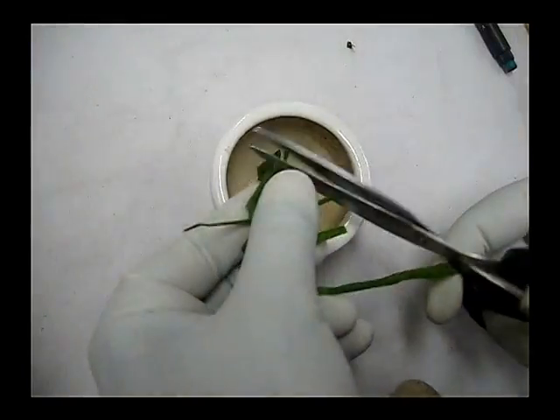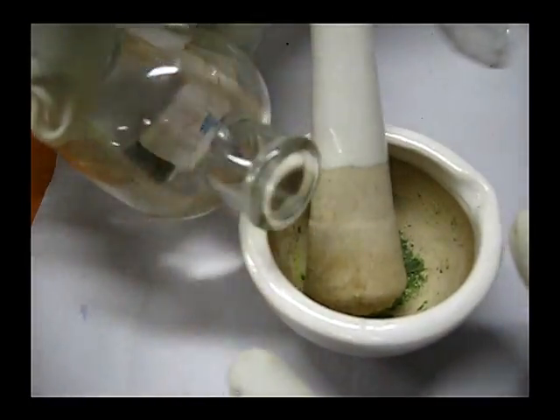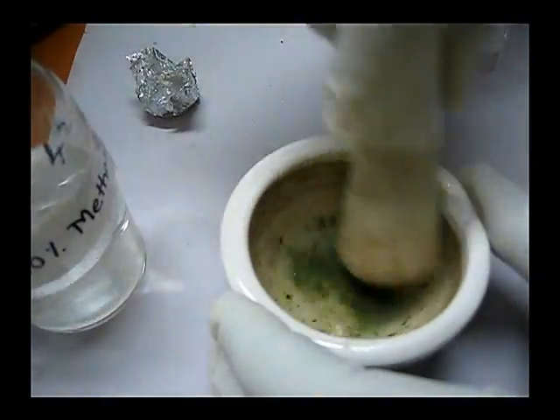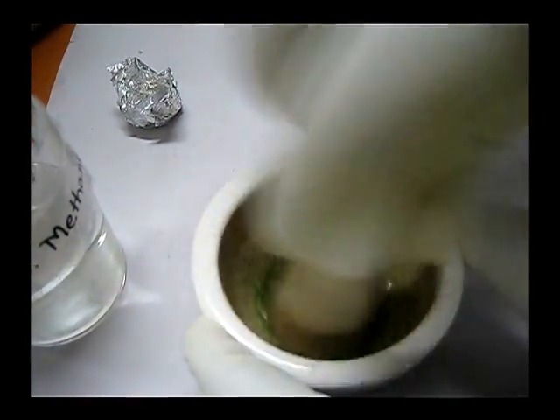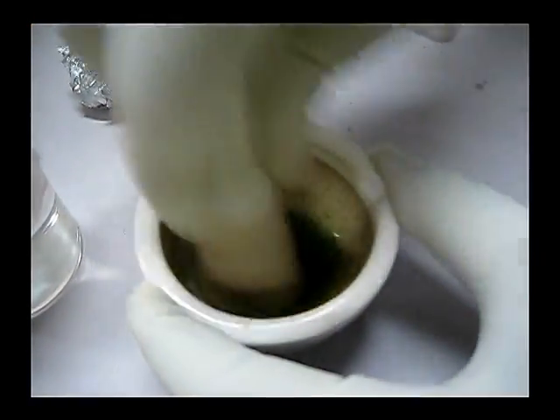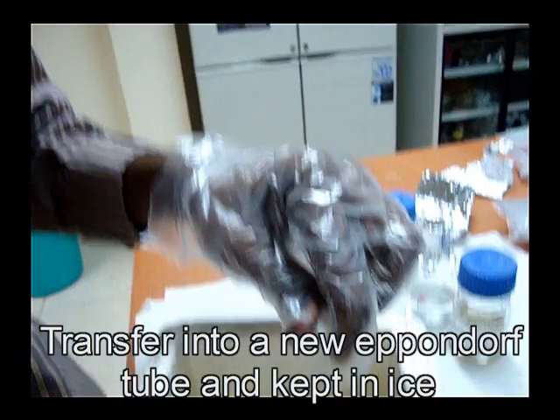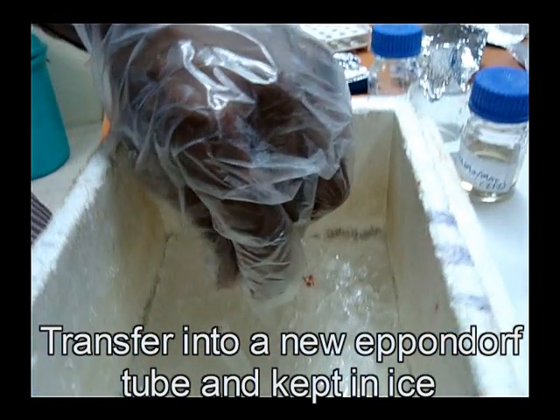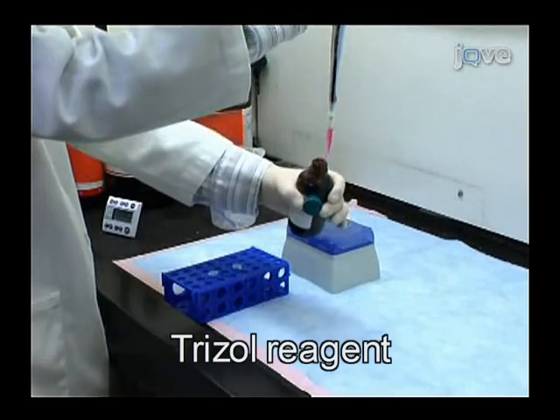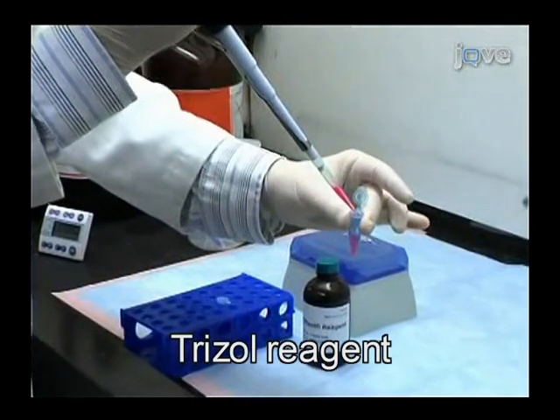The sample is finely cut and ground using liquid nitrogen. Transfer the ground mixture into a DEPC-treated Eppendorf tube. Add 1 ml of tri-reagent and incubate at room temperature for 5 minutes.